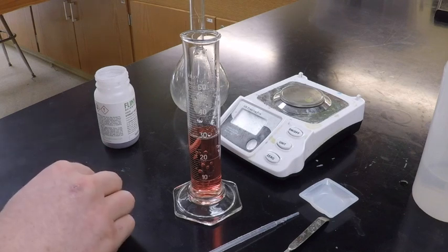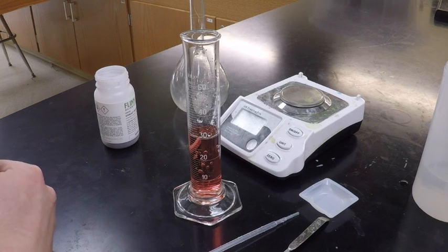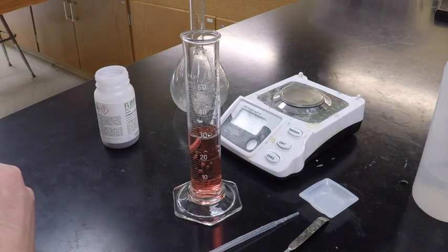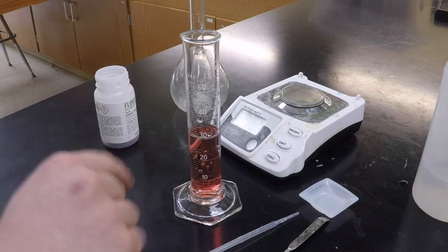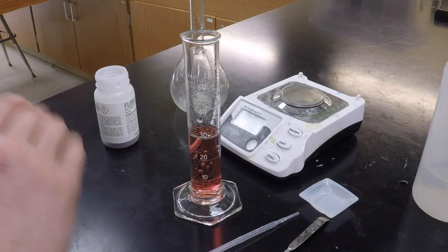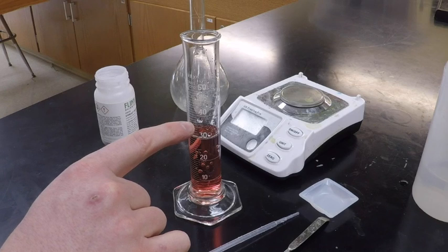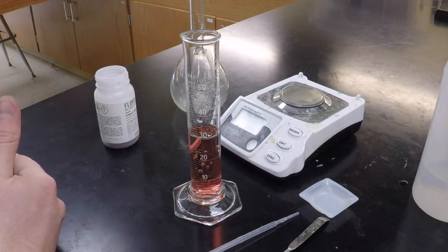I could change that to moles, but remember in our problem we divided by 0.03 liters, and instead I would have to divide by 0.04 liters. So that would not give me 0.25 molar. So you have to be really careful with this and make sure you don't overshoot your volume. Now, if you overshoot it by a tiny bit, that's not going to make a big deal. But if you're supposed to have 30 milliliters and you accidentally go to 40, that's going to be an issue and your solution would end up being wrong.